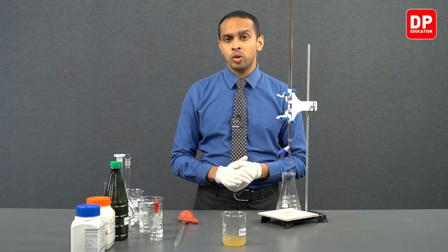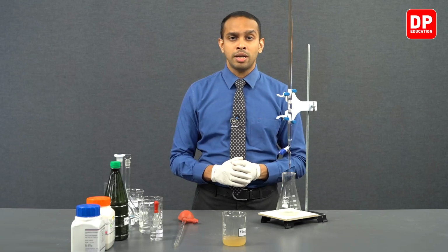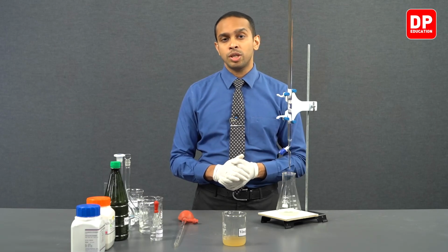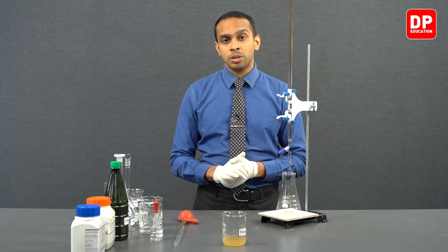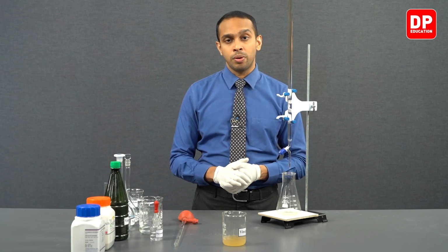Therefore, since we know the end point, we can proceed to add sodium hydroxide all the way up to around 19 or 20 cubic centimeters without any hesitation, as we do know that the end point is going to be obtained close to 21.3 or 21.4. So just to be on the safe side, we usually start adding sodium hydroxide drop by drop after we have reached a volume of around 19 cubic centimeters, just to make sure that we do not pass the end point.